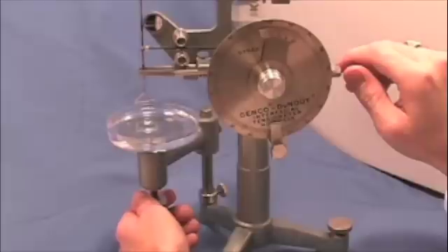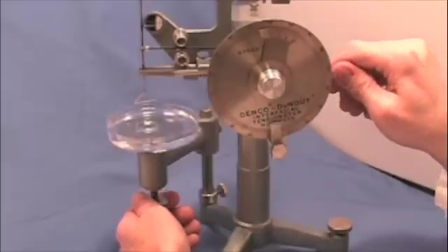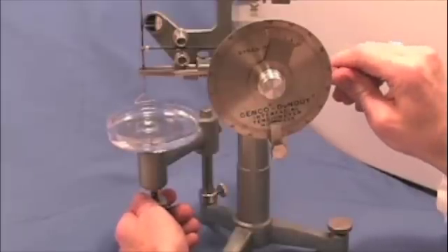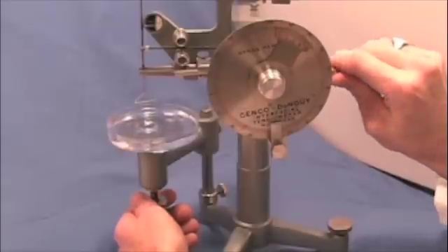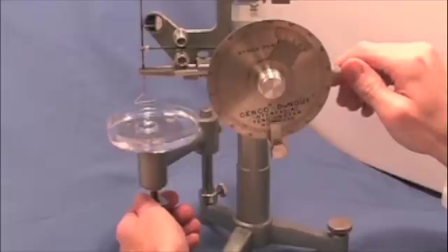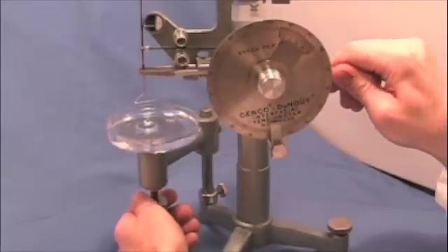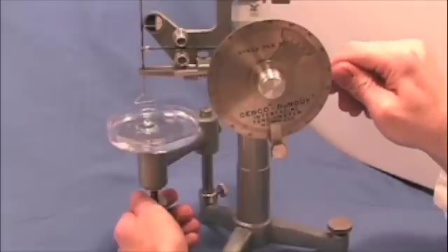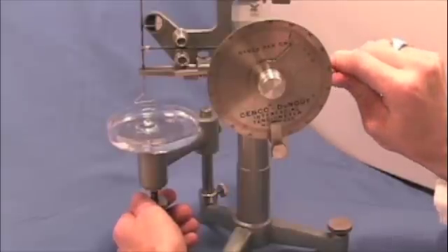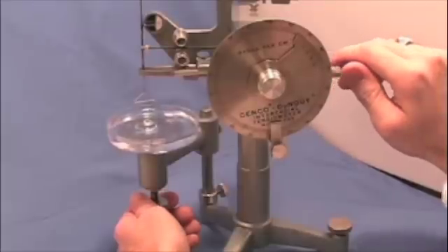You can see, if you look at the ring, the strain on the surface of the liquid now. It's getting close to the breaking point. Lower a little bit more. Compensate with the right hand and read the gauge. Lower the sample table. There's a nice deflection on the surface of the liquid now. Lower a bit more. Adjust with the right hand.